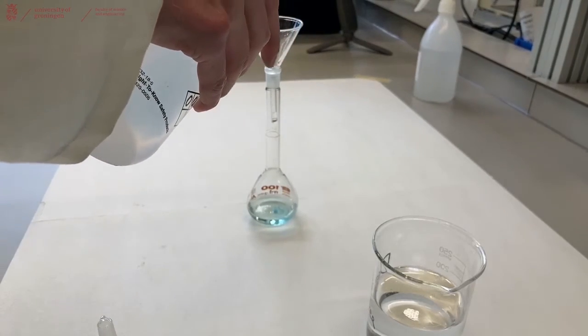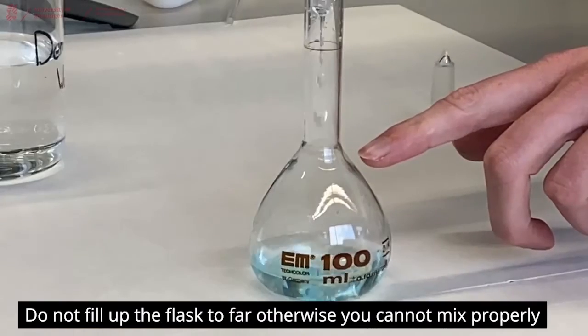And then fill up the volumetric flask up to below the neck.